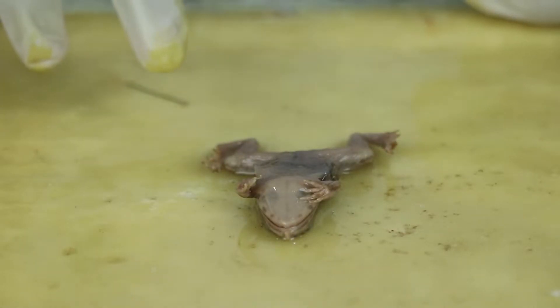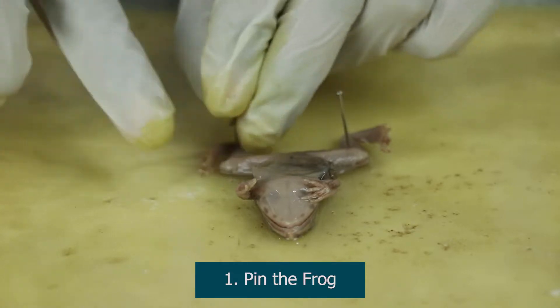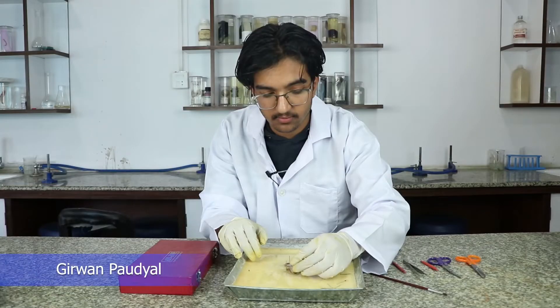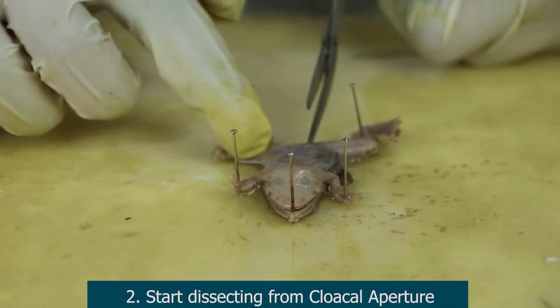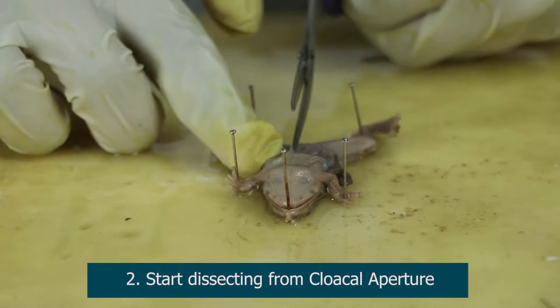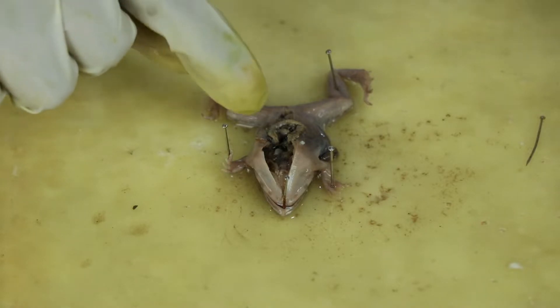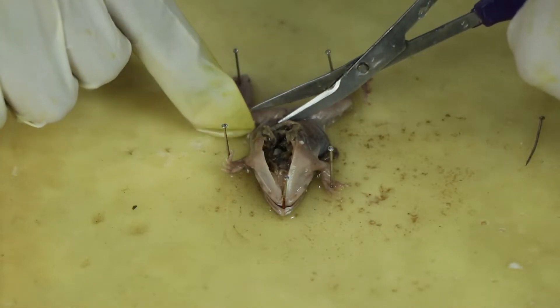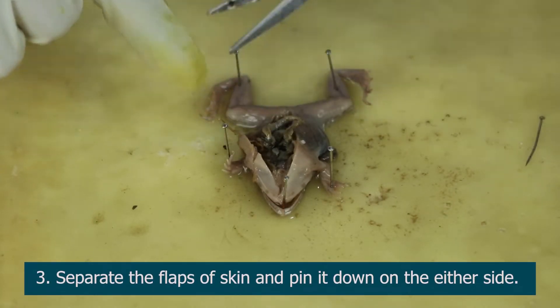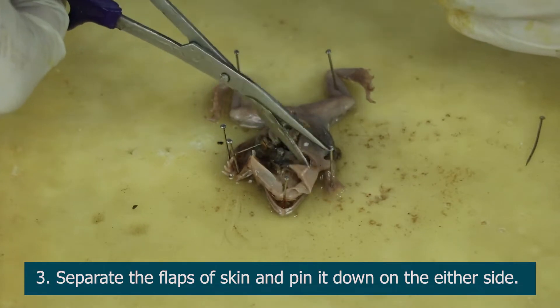The frog is laid on the dissecting tray and two pins are inserted into the pair of hind limbs, two pins into the forelimbs, and one at the tip of its mouth. We start with a small incision near the cloacal aperture up to the lower jaw. Now we cut the flaps of the skin near the hind limbs and the forelimbs to expose the frog more distinctly, and we pin them down. We do the same on the other side.